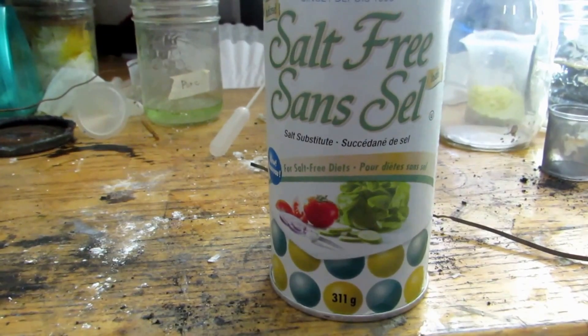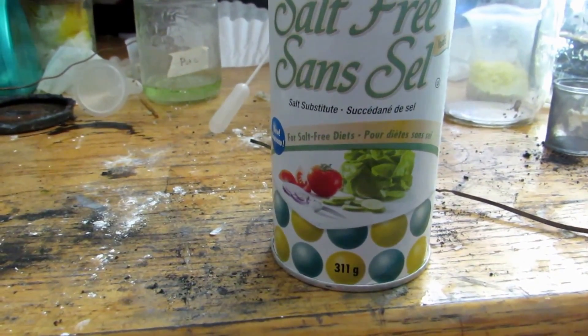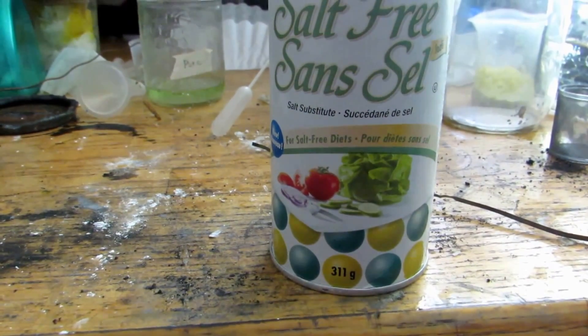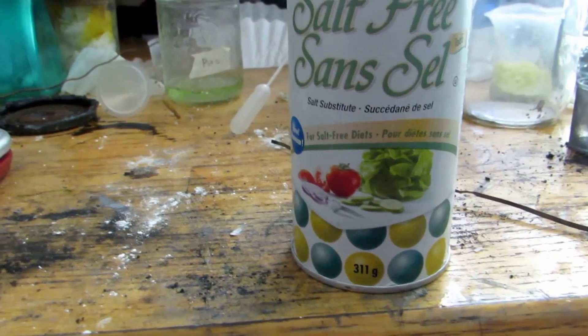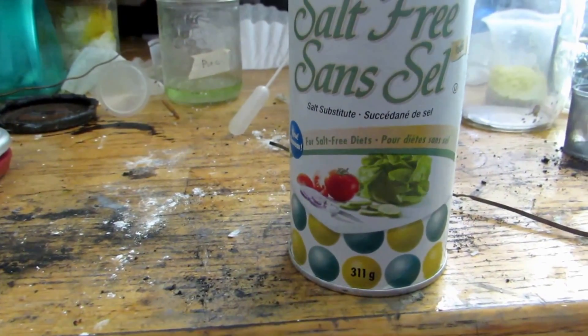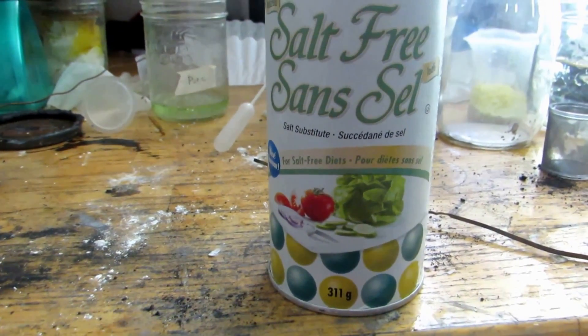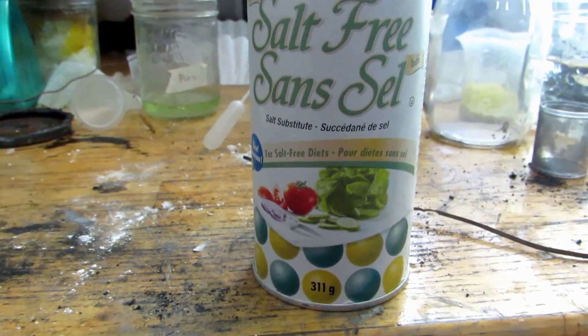So I got this particular one from Thrifty's, and I wasn't actually able to figure out anything online that showed exactly the ratios for this electrolysis. So I'm just going to do half and half by weight. So I'm going to weigh out how much strontium chloride we have and then do the equivalent of potassium chloride. Then we're going to set up a small electrolysis cell and electrolyze it.